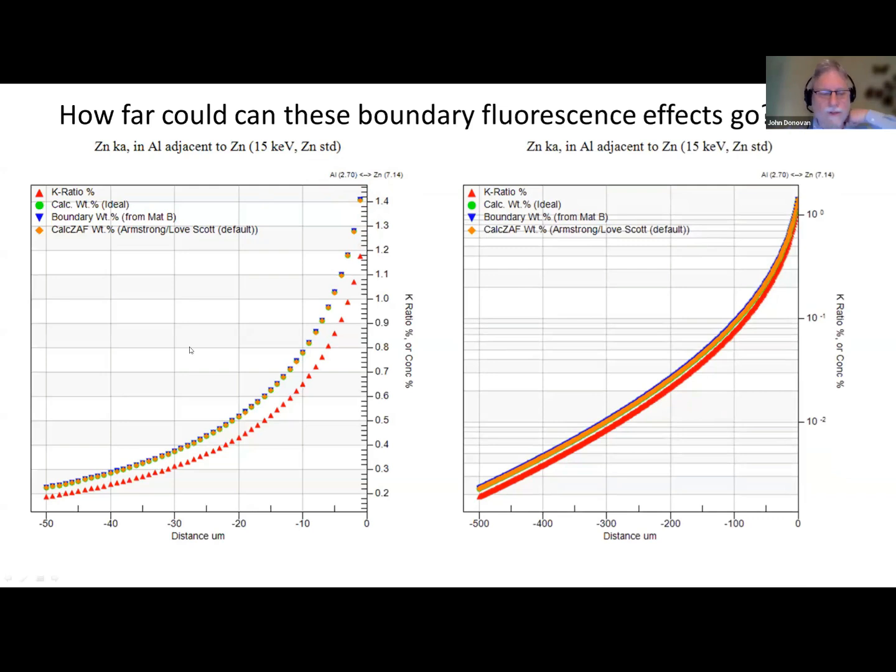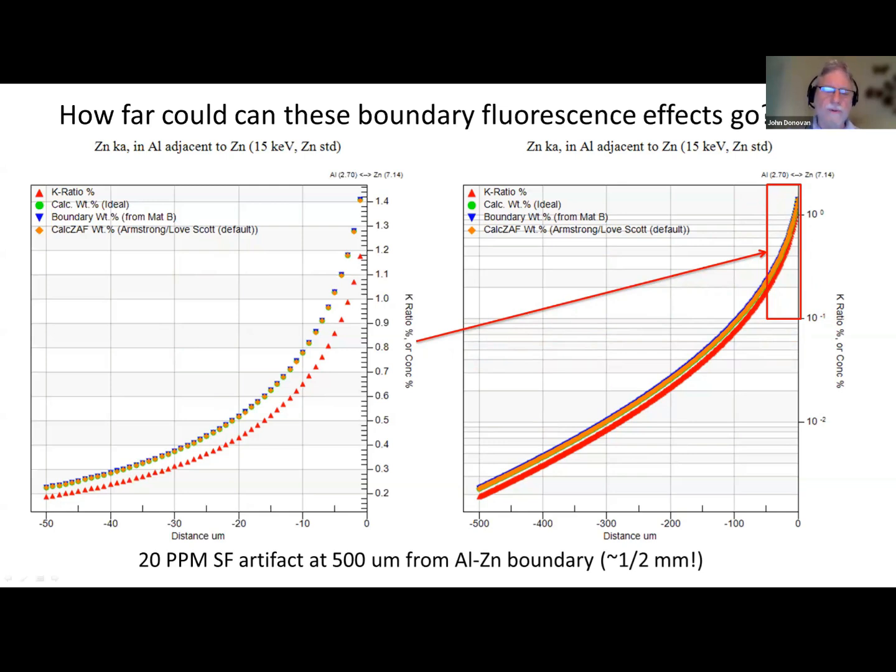Now, here's the interesting thing. Here we only went out to 50 microns. Here I went up to 500 microns, half a millimeter away, and you see we haven't reached zero yet. In fact, this whole graph is represented in this little box right here. This is a log scale, clearly. We're still getting 20 parts per million at half a millimeter from the boundary, because zinc K alpha is a very penetrating X-ray. And this is just continuum X-rays, because aluminum can't fluoresce the zinc K edge. Just the continuum from aluminum is exciting zinc half a millimeter away from the boundary. So consider that.